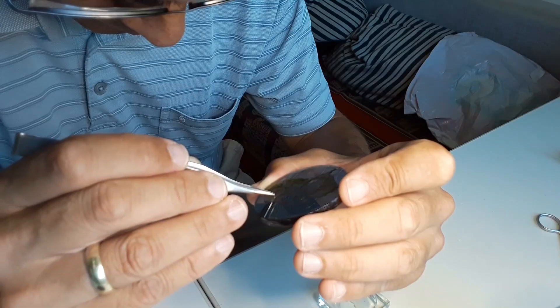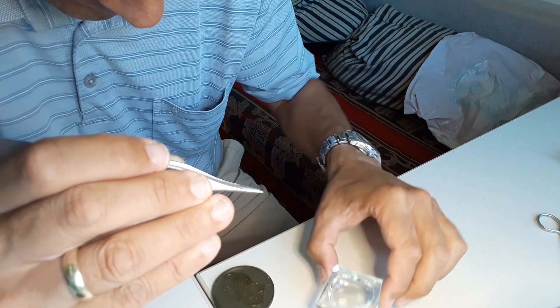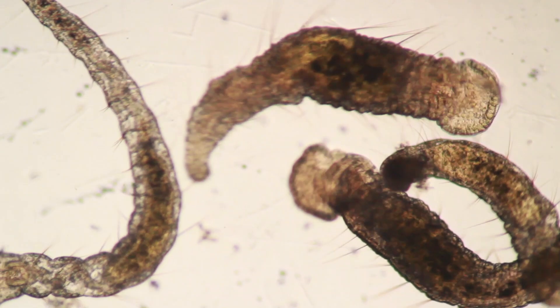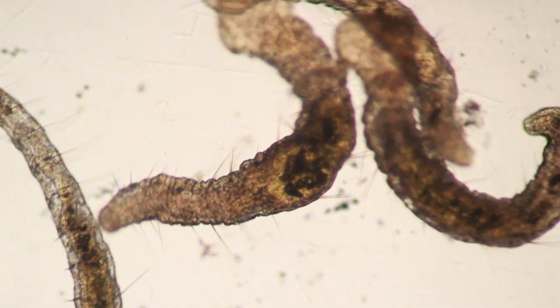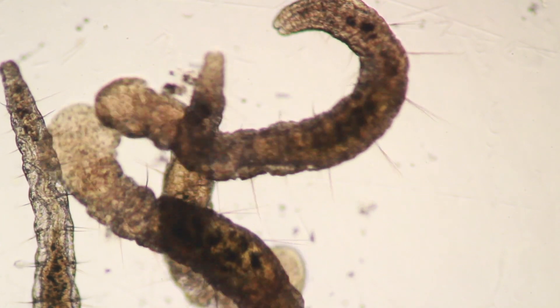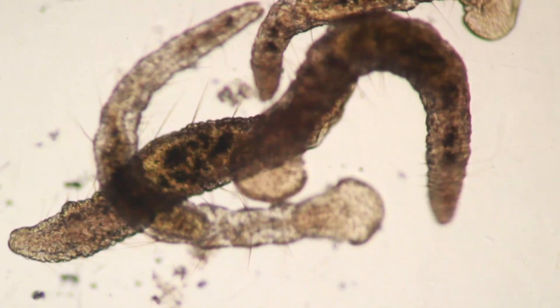It was a little bit of tedious work — they're kind of small and tiny, and it's a little bit difficult to use tweezers to take them out of the algae without squeezing them to death. But with a little bit of patience I was able to get them out and keep them alive in my little glass dish for over a week. They were moving around quite happily, and I was quite surprised that none of them were actually damaged by the tweezers.